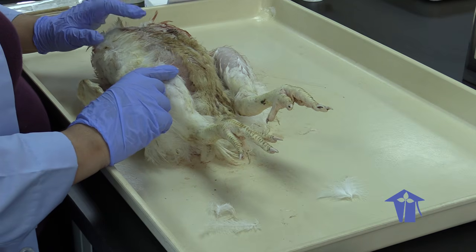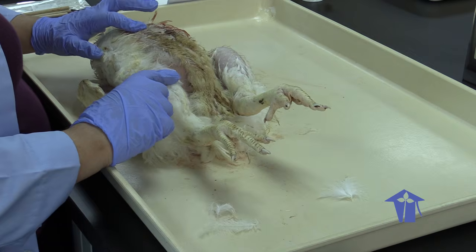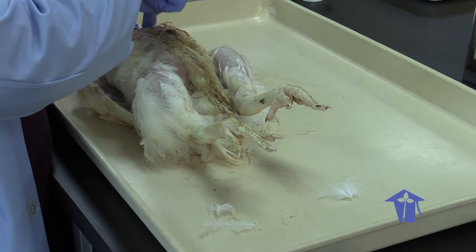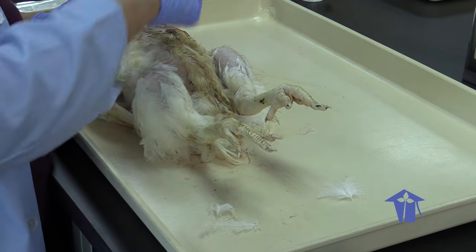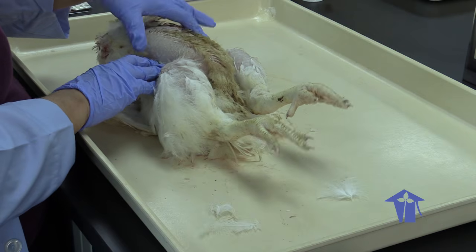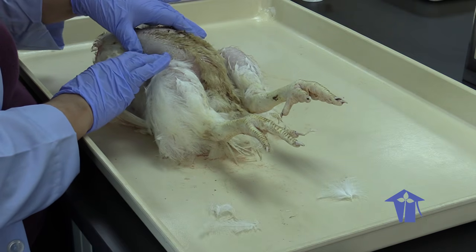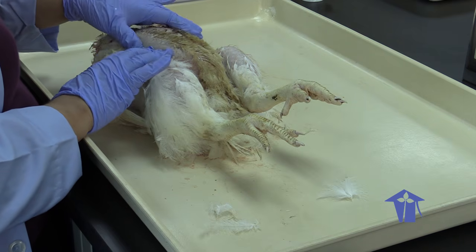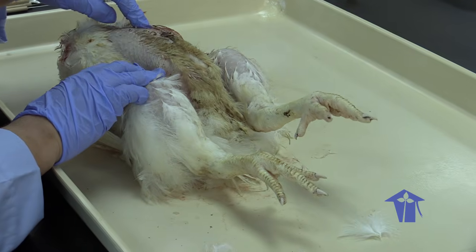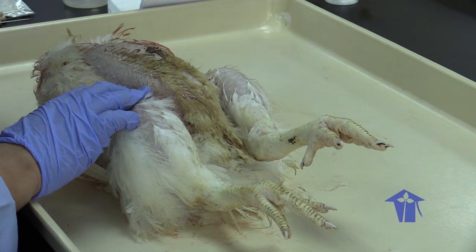Now, the chicken is going to be a little different. If I were cutting open a frog, for example, I would cut up the mid-ventral line to go through the middle of the frog. However, because this chicken has this huge block of breast meat, which is the flight muscle, or what would be the flight muscle in a flying bird, it's difficult to cut through here in order to get to the digestive system, into the visceral organs.